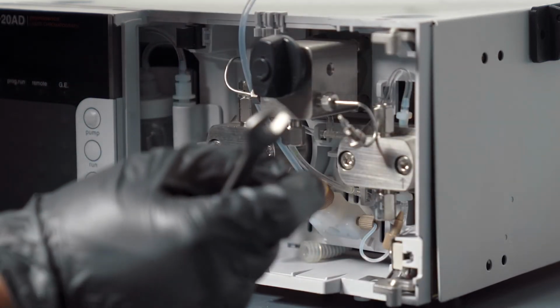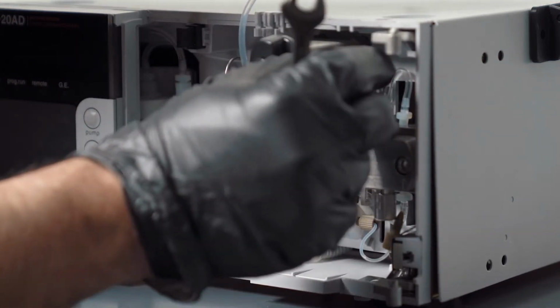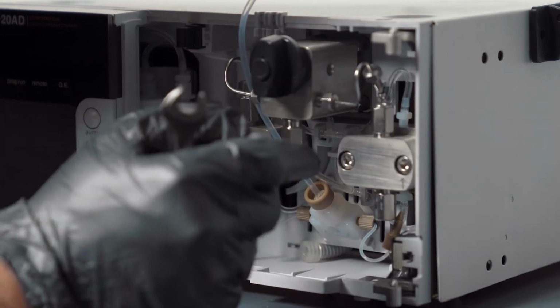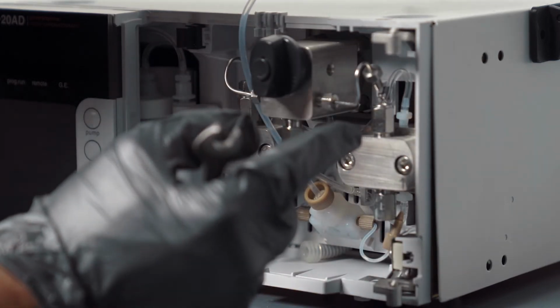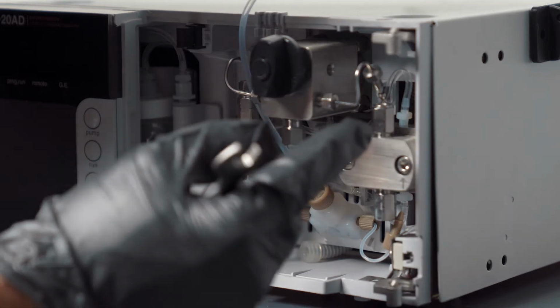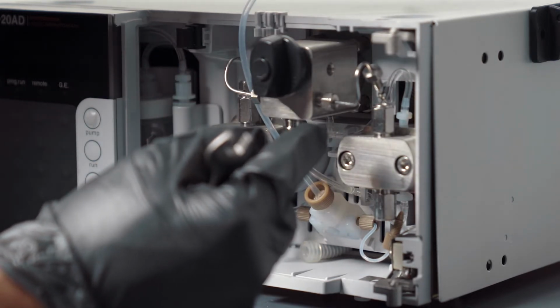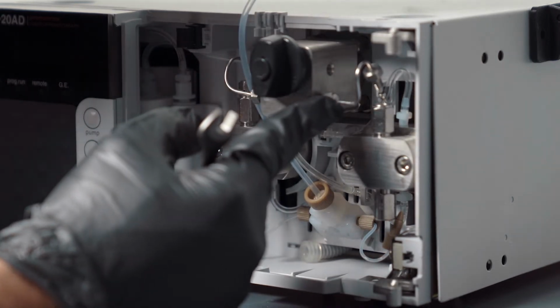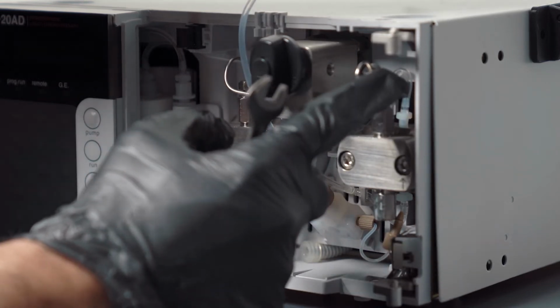The reason why you want to loosen these two is because you want to be able to do this. And you see how this flips out nicely like that? If this were still screwed in tightly, you would not be able to flip it out, and then you'll bend this tubing here. And then it'll never be this pretty shape anymore. And every time you look at it, you're gonna be disappointed that you bent your tubing. And then you're gonna wanna buy another piece of this tubing that's gonna cost a lot of money. And then you're just gonna be like, why did I do that? So I'm telling you, unscrew it from here so you don't have a life of regret. And if you have a bent tube in your lab, you know exactly what I'm talking about.